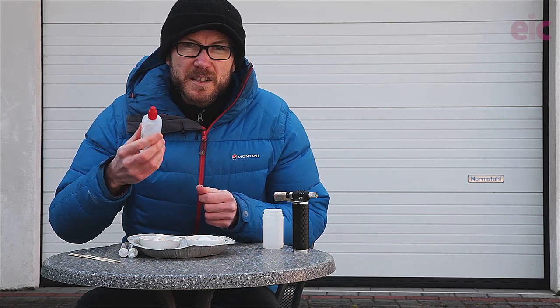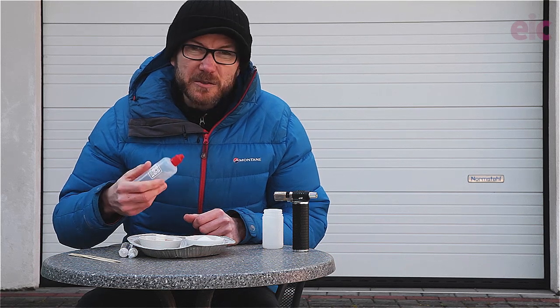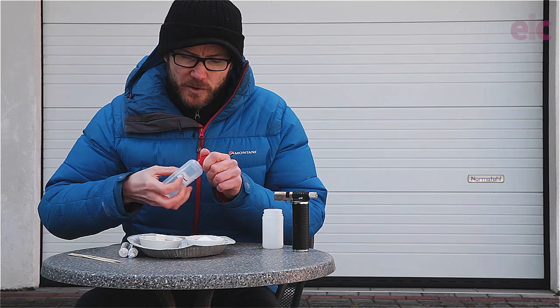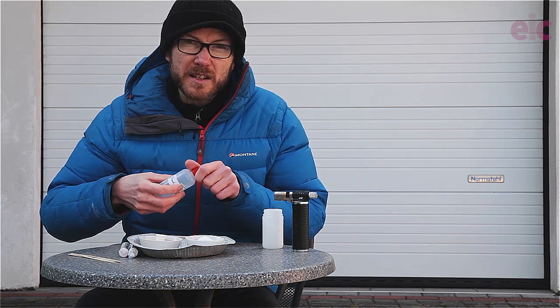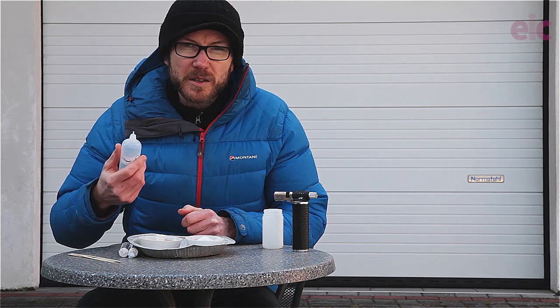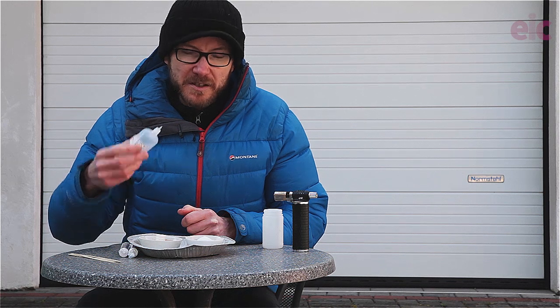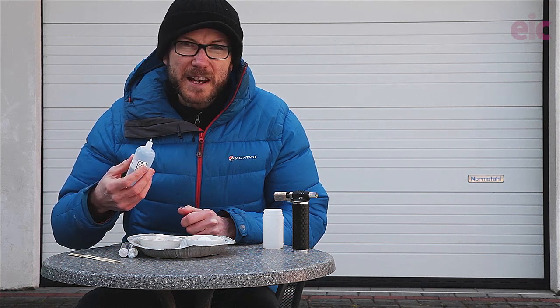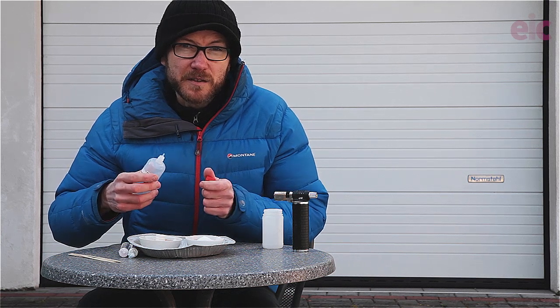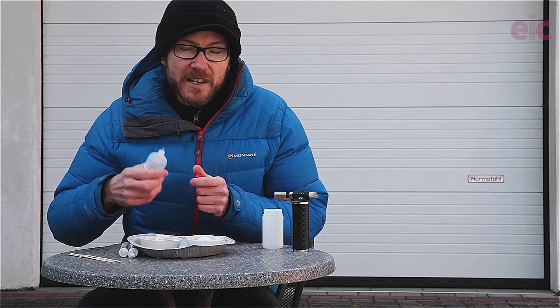Then what you're going to want to do is just a couple of ml of ethanol around the base in order to actually initiate the reaction. Of course as soon as you expose this to a naked flame you want to make sure that you're not going to try and reignite this. Ethanol burns with quite a poorly coloured flame, so you don't want to be tempted to pour ethanol back onto the mixture after you've tried to initiate the reaction. If it doesn't work first of all, do make sure that you stand back and don't pour extra ethanol on top.